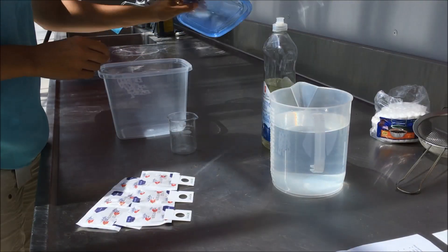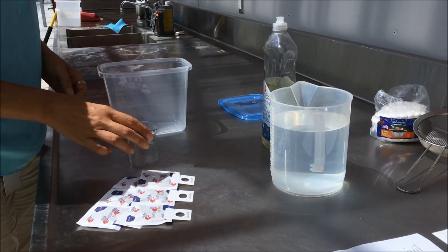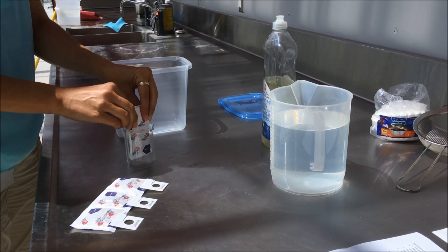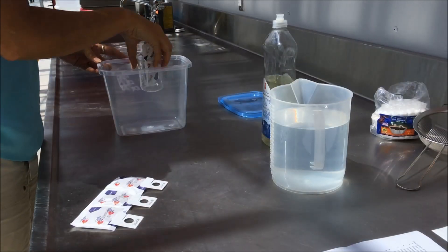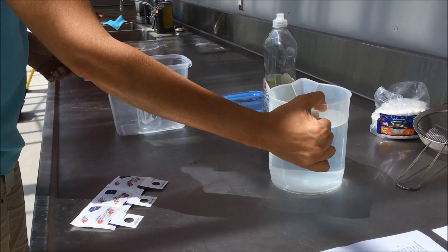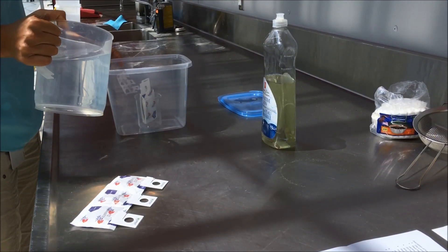Here is how to monitor weekly walkout. In order to get a reliable sample of the whole box, use a minimum of six sachets. Place the sachets in a small, heavy glass on the bottom of a plastic container. You can put multiple sachets together, but if you put too many, it may be difficult to count later.